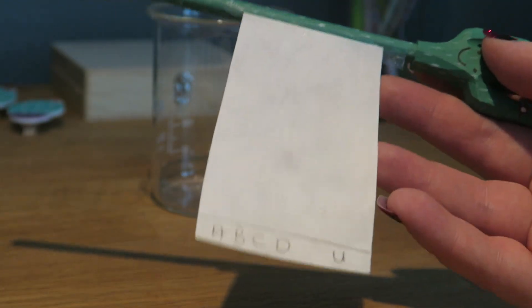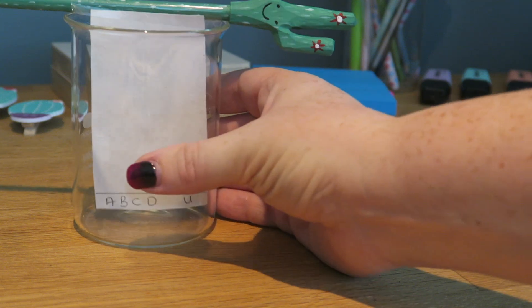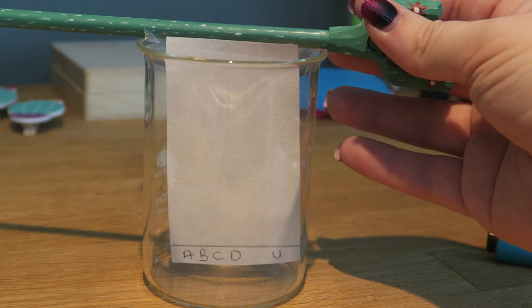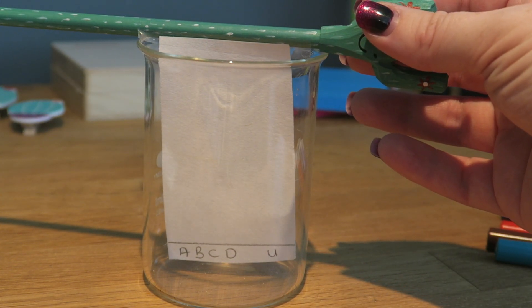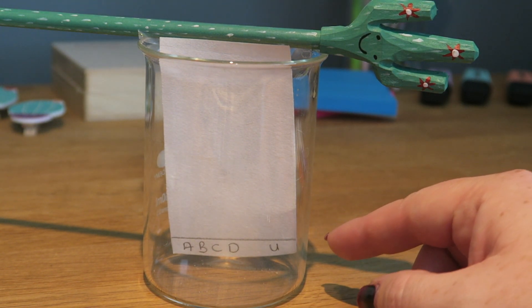I've attached this to the pencil, you may have attached this to a splint, and then I'm going to put it in my beaker. It is important to note that the filter paper isn't touching the sides anywhere.